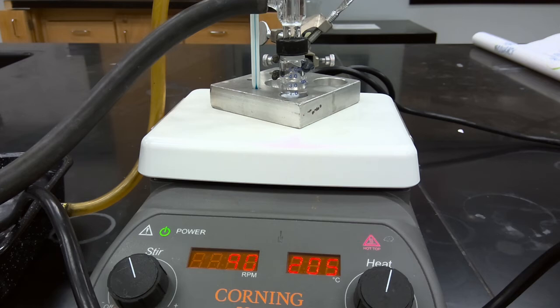Okay, so we are looking at lab 8B. We're taking isopentyl alcohol and acetic acid and generating isopentyl acetate under acid catalyzed conditions. So in our vial, we've already prepared isopentyl alcohol, 800 microliters, 1.5 milliliters of acetic acid, 4 drops of concentrated sulfuric acid, and 100 milligrams of silica gel beads.